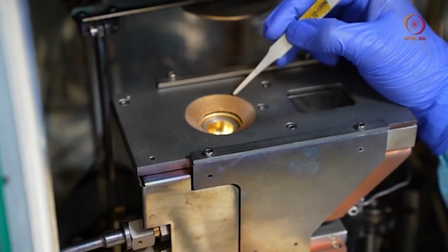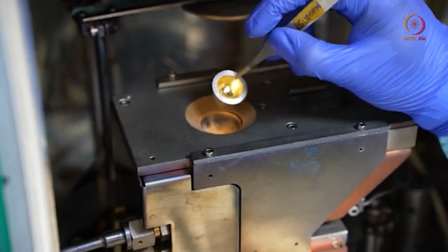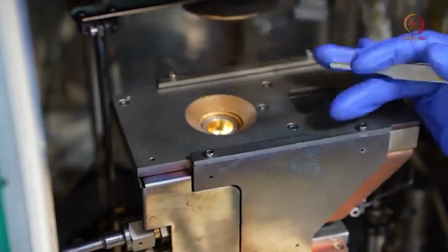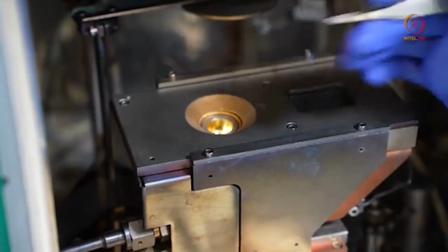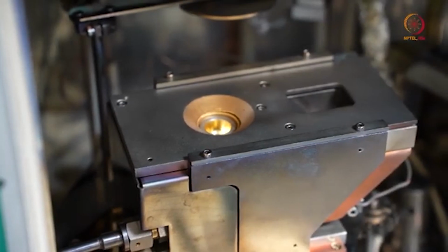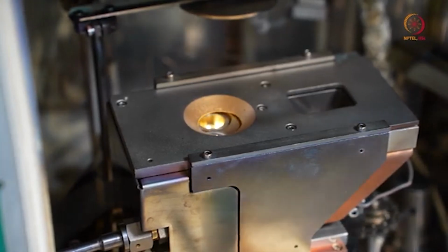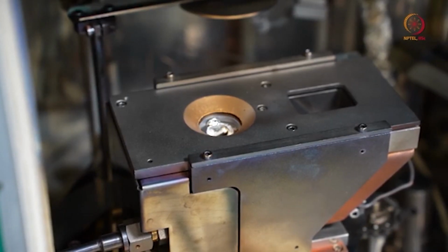Here, I guess from the color you can understand that this is gold. I'm just taking this out to show. So gold is loaded here. You have to remember which crucible corresponds to which material, or what type of material is loaded in which crucible. You have to keep a note before deposition, so that you can deposit without making any mistake. And here, this crucible is aluminium.